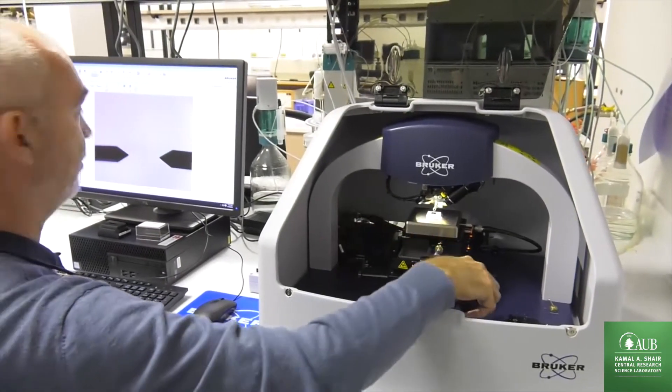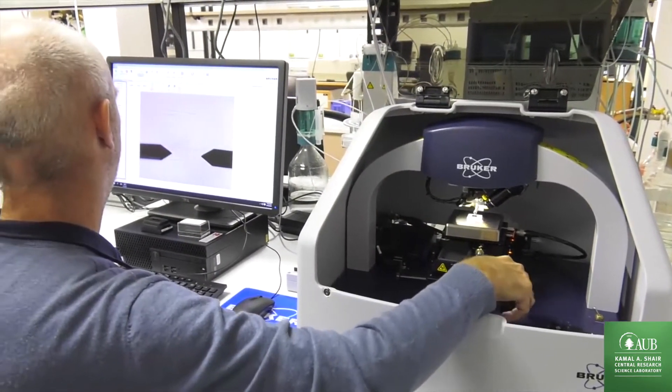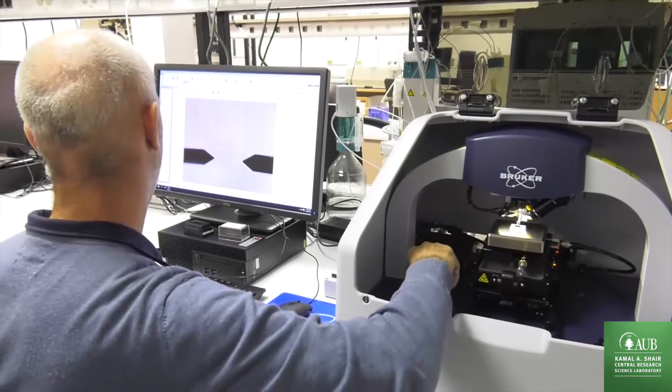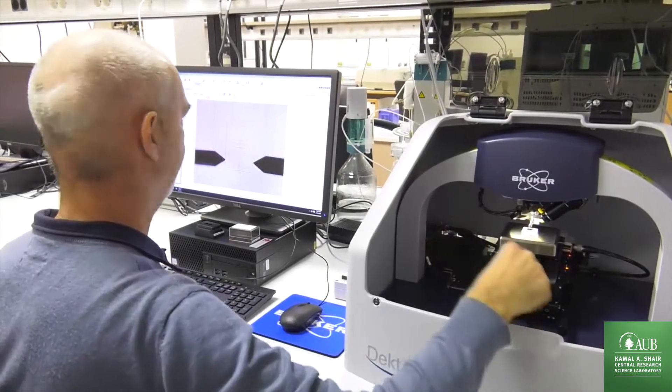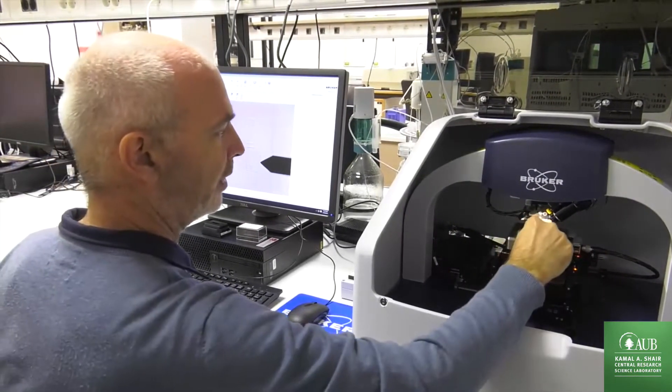The intended measuring point. Maybe adjust the sample a bit.